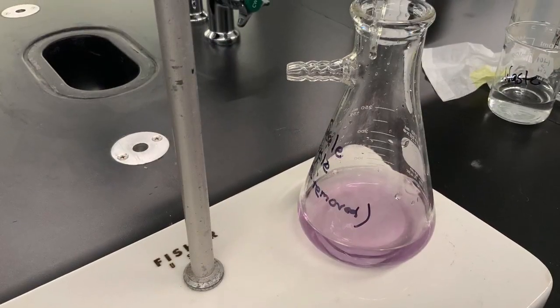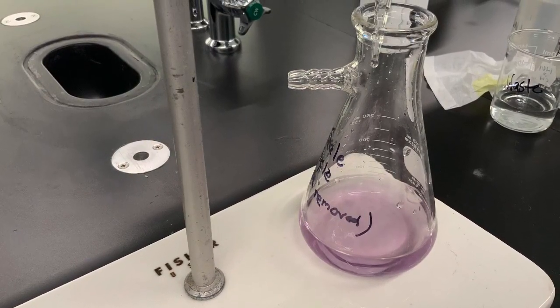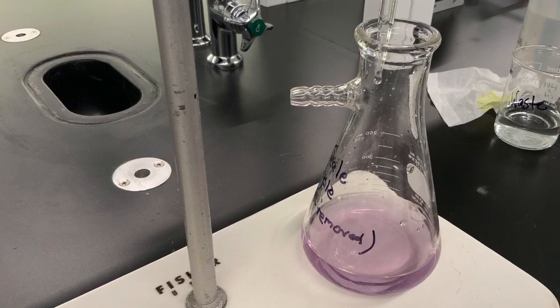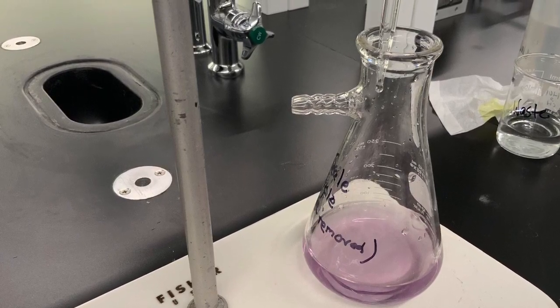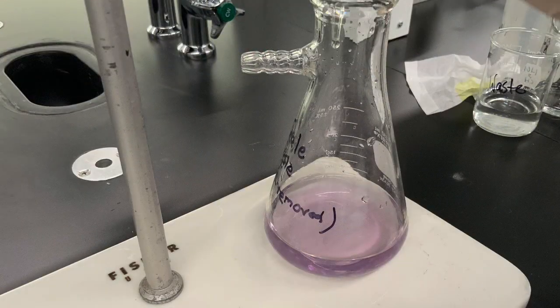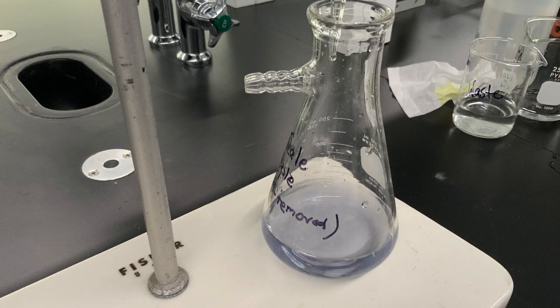With the first fast run, we determined the total volume of EDTA solution that was needed to complex the calcium in our sample. And in the second run, when we're just 1 milliliter away from that total volume, we slow down the release of the droplets until we're about 1 drop every 5 to 10 seconds. And then we will be able to determine the very last drop or even half a drop that is needed to change the color of our solution from almost blue to completely blue. And the closer we get to that point, the more accurate our result.